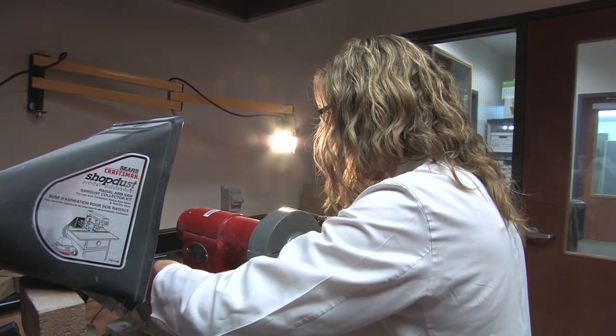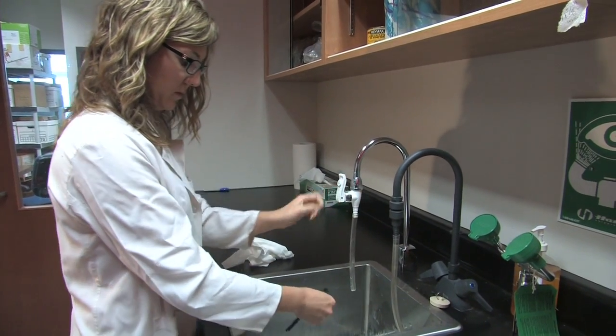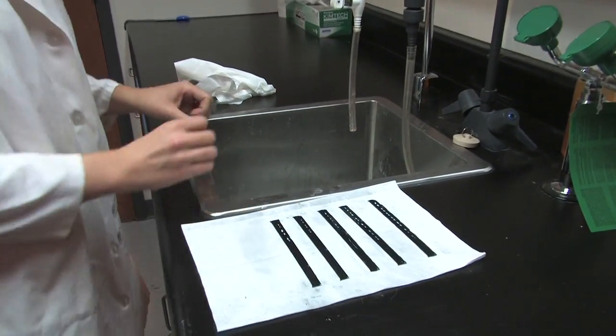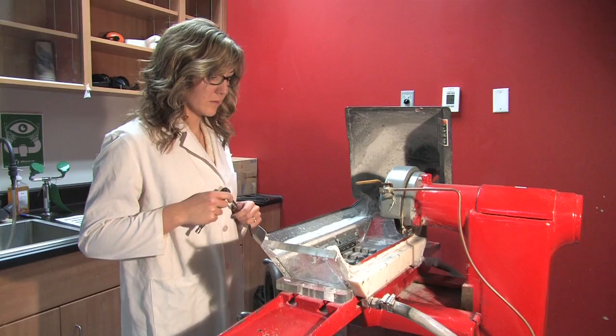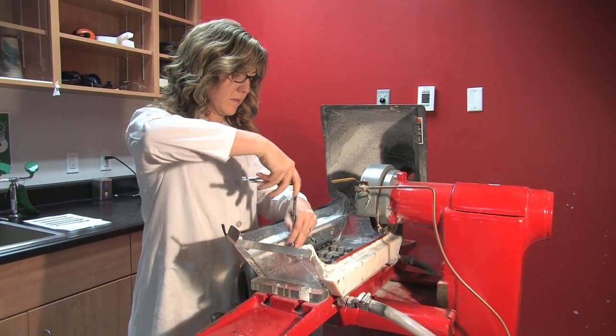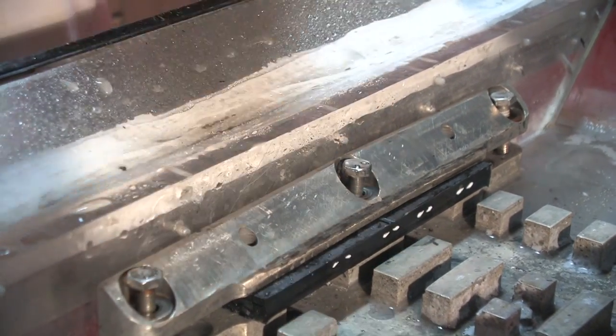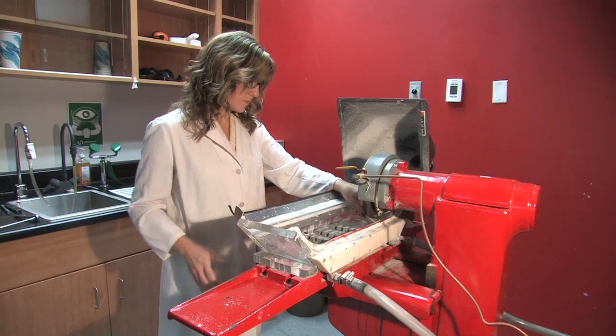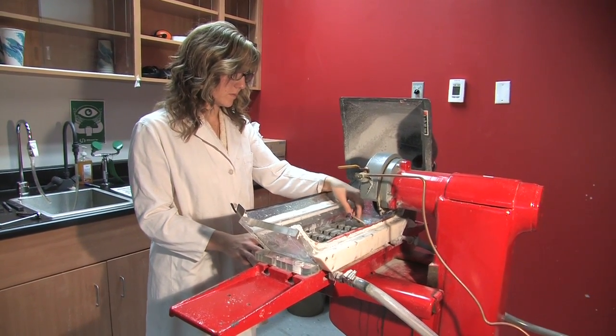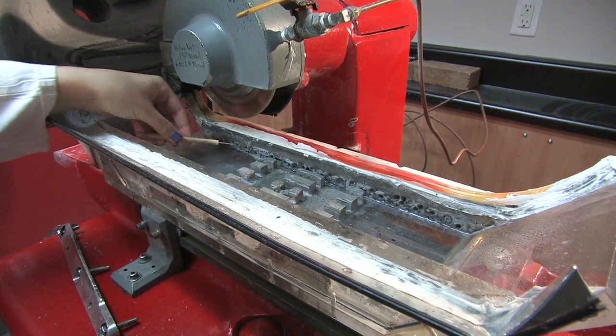After your last cut, remove the final section. Rinse the sections off in water and then put them on a piece of paper towel just to air dry. When finished cutting, remove the remainder of your plate and let the water drain out. And just be sure to clean the saw up when you're finished. If you notice any debris, use the probe to poke through the little drain holes in the bottom of the tray just to clear any debris that might have built up.